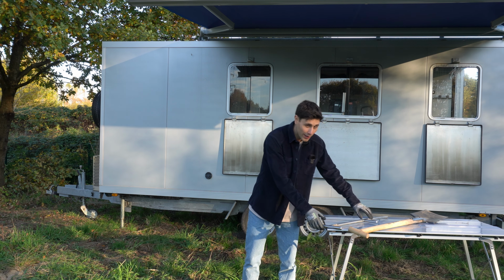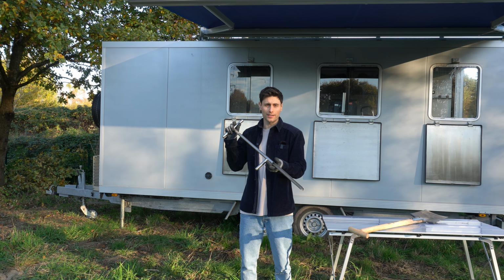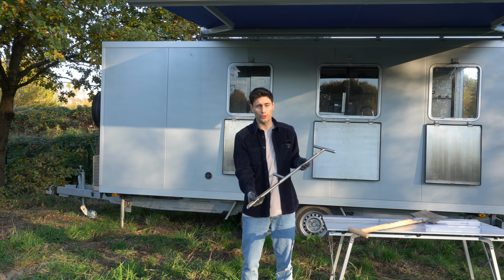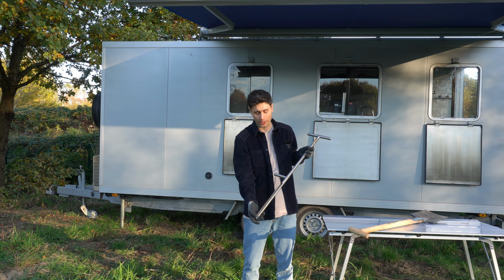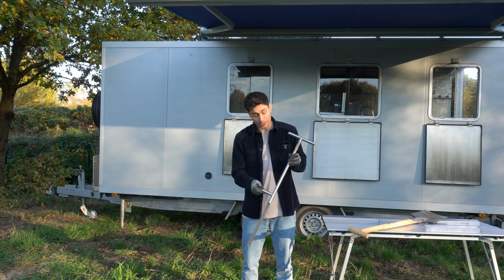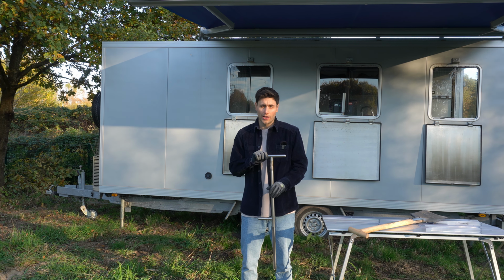Okay, so let's start to get a bit more practical. This is a soil probe, and this is useful if you want to do regular soil sampling. It's very easy with this soil probe to get consistent samples because you will have a uniform cross-section along the depth of your soil. There are simple T-shaped models and some models like this one, which also have a footstep, which makes it a bit easier to get the soil probe into the soil.